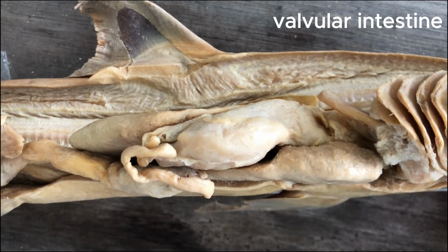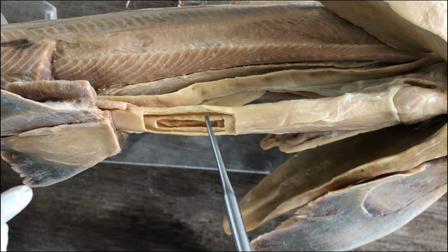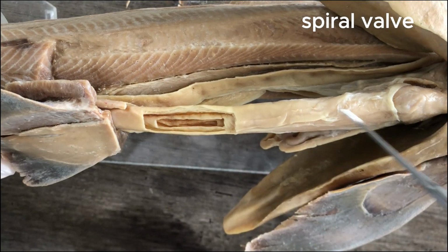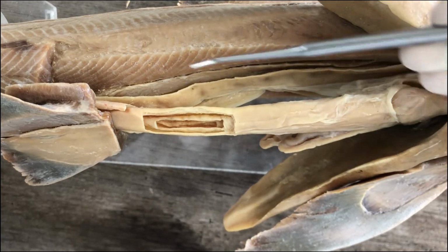Because if you open up the valvular intestine, there's a unique structure inside its wall called the spiral valve. So the inner wall of the valvular intestine is actually coiled into a kind of spiral staircase.